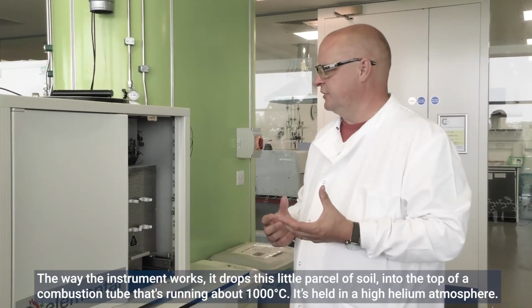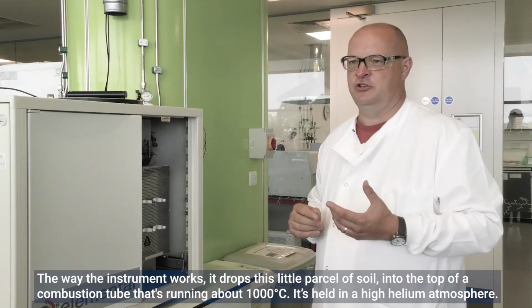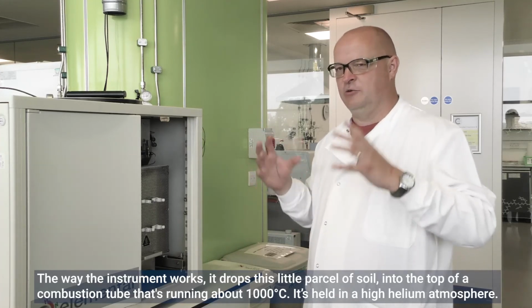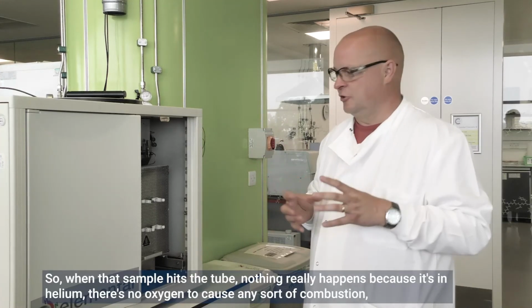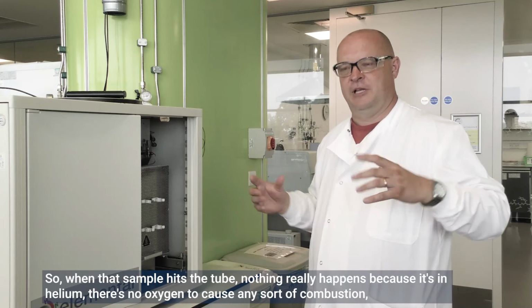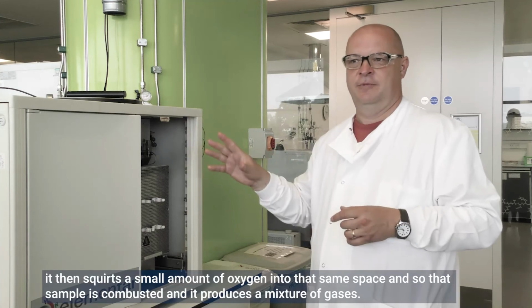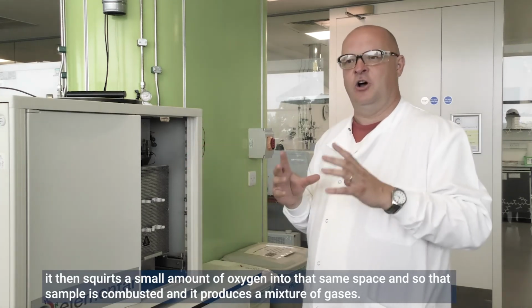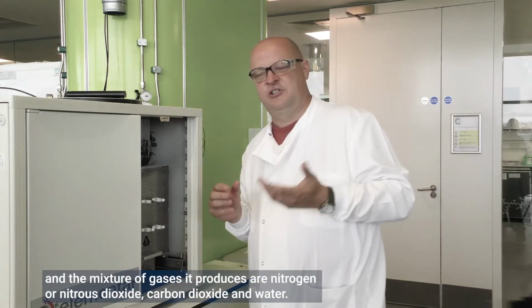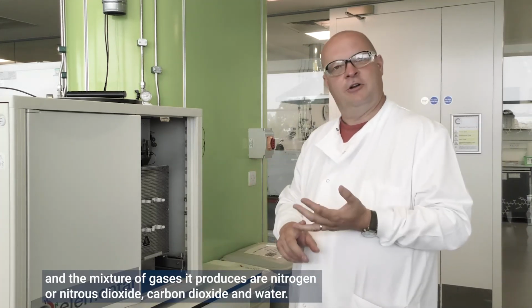The way the instrument works, it drops this little parcel of soil into the top of a combustion tube. That's running at about 1,000 degrees centigrade. It's held in a high helium atmosphere. So when that sample hits the tube, nothing really happens because it's in helium. There's no oxygen to cause any sort of combustion. It then squirts a small amount of oxygen into that same space until that sample is combusted. And it produces a mixture of gases. The mixture of gases it produces are nitrogen, or nitrous dioxide, carbon dioxide and water.